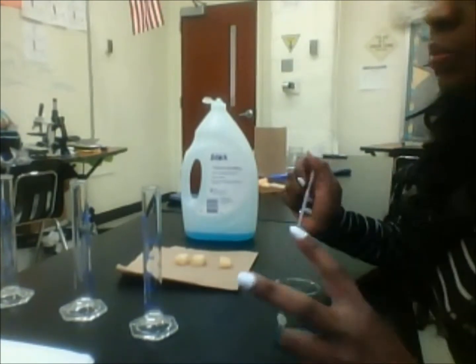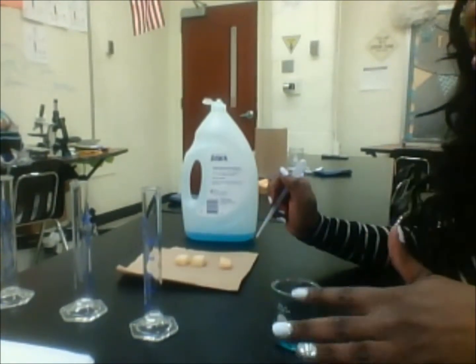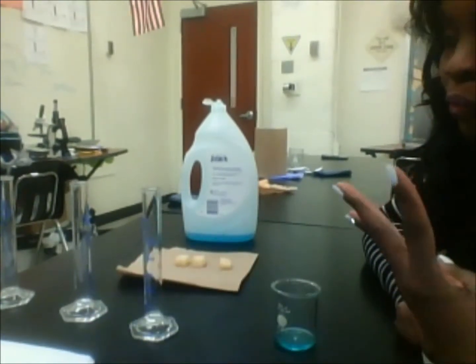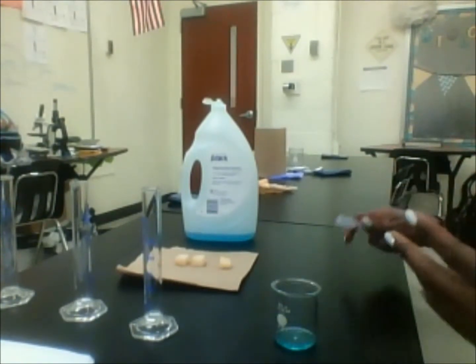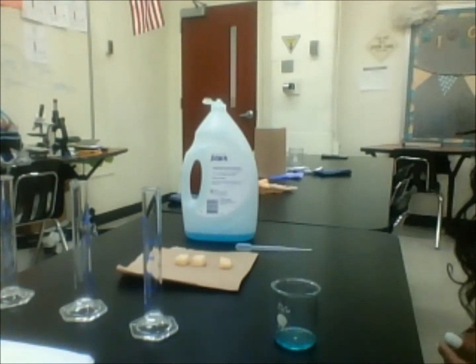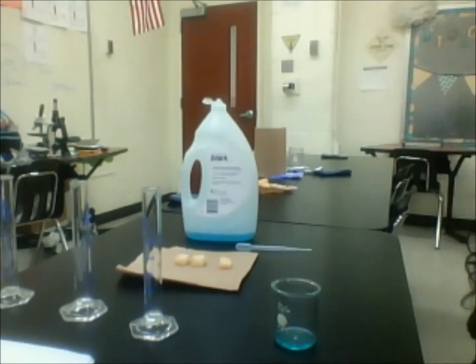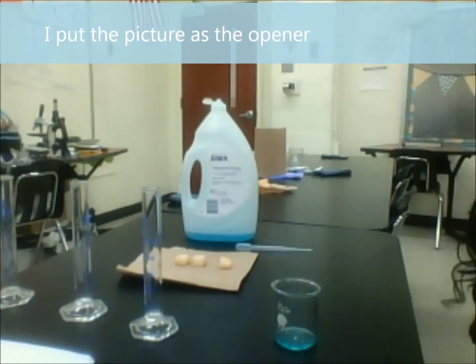So basically this is what we did. Just for the sake of this demonstration, I'm only going to show you 3 graduated cylinders, but today in class we actually used 4 for this lab. What I saw initially, and I'll put the picture in the video, was in one of these little groups.